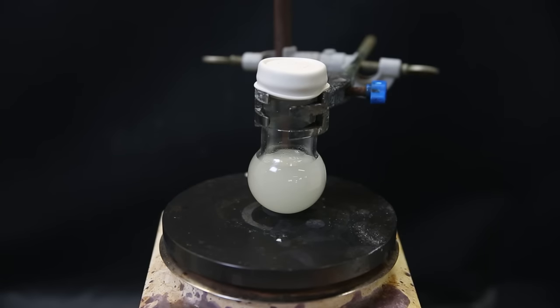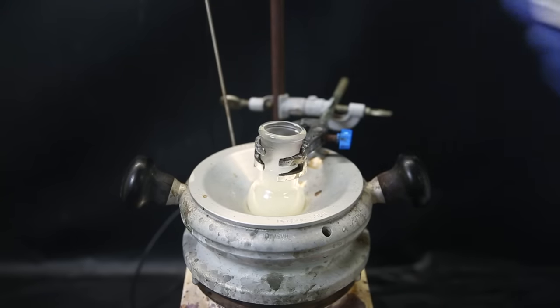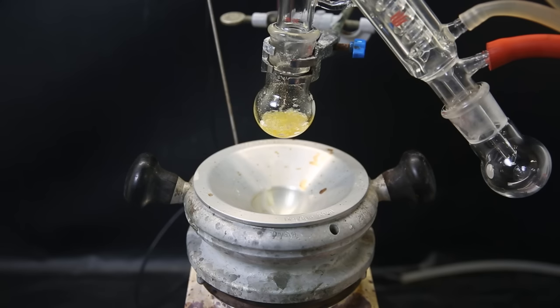After two hours, while the reaction should be finished, it has become white and cloudy. I then set it in the heating block and remove the septum. I attach a short path distillation apparatus and heat the flask to distill off all of the solvent. When pretty much all of the solvent is gone, a yellow residue is left behind. I try to dry it out completely by pulling a vacuum, but it is really snotty and just explodes around.